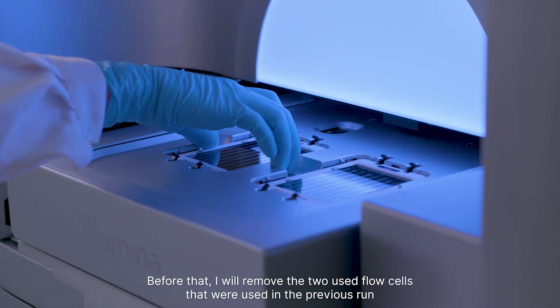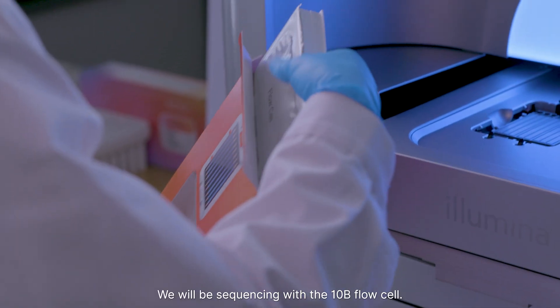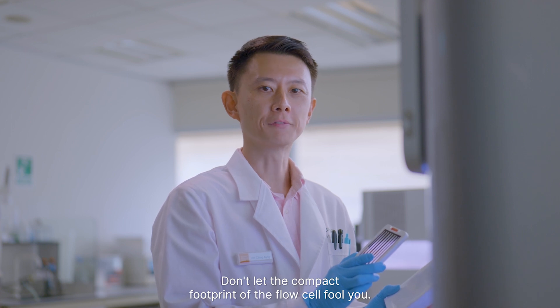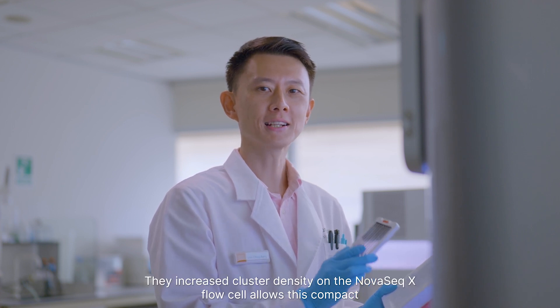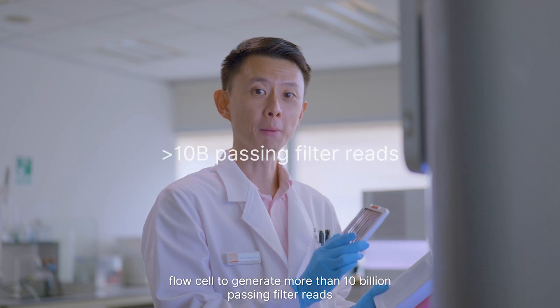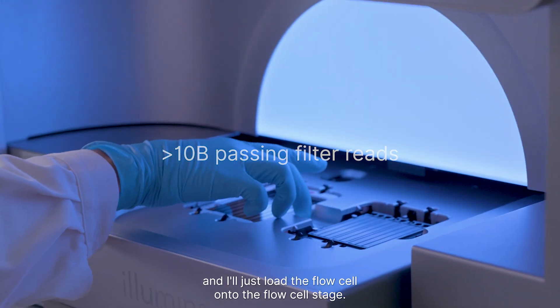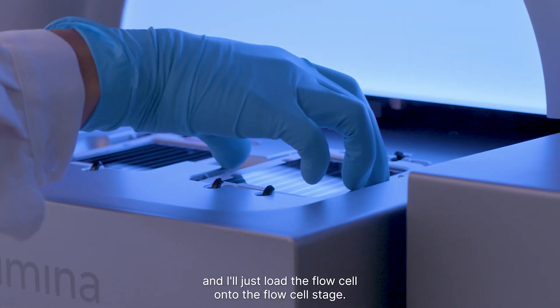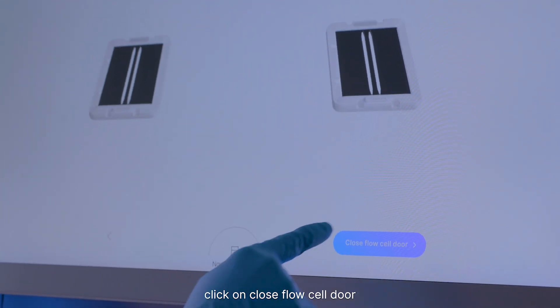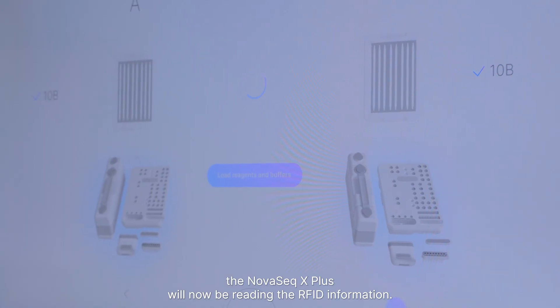Before that, I will remove the two used flow cells from the previous run. We will be sequencing with the 10B flow cell. Don't let the compact footprint of the flow cell fool you — the increased cluster density on the NovaSeq X flow cell allows this compact flow cell to generate more than 10 billion passing filter reads. I'll load the flow cell onto the flow cell stage. Now that both flow cells have been loaded, click on Close Flow Cell Door. The NovaSeq X Plus will now be reading the RFID information.